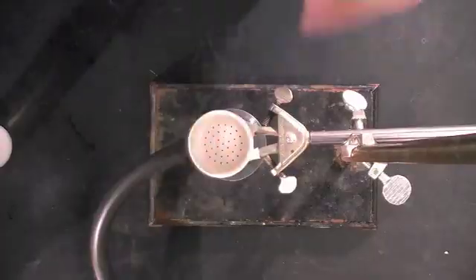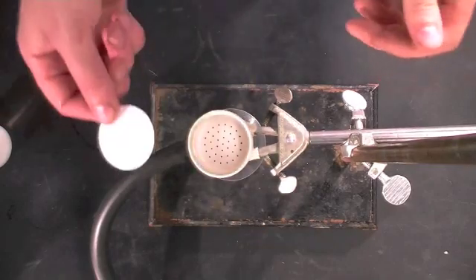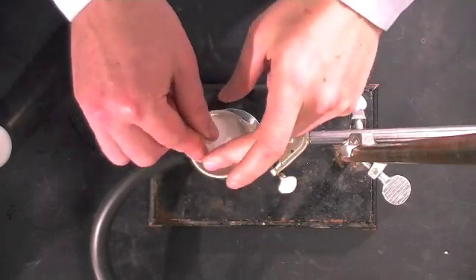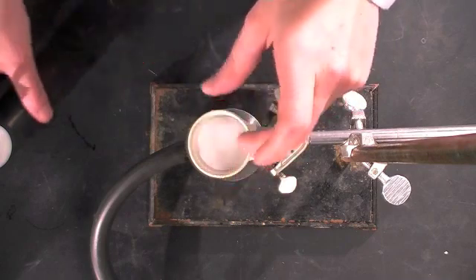Now that you have your Buchner funnel set up, place the filter paper in the funnel. Make sure it's covering all the holes.